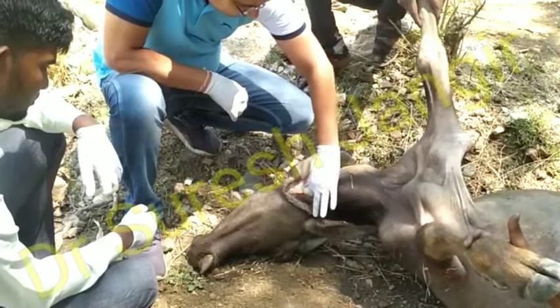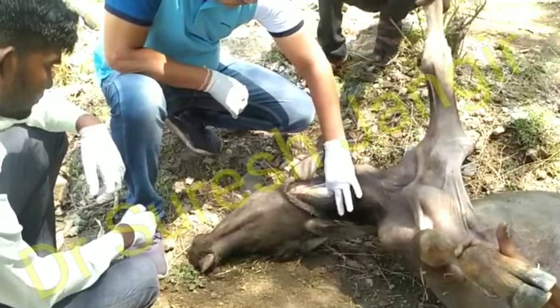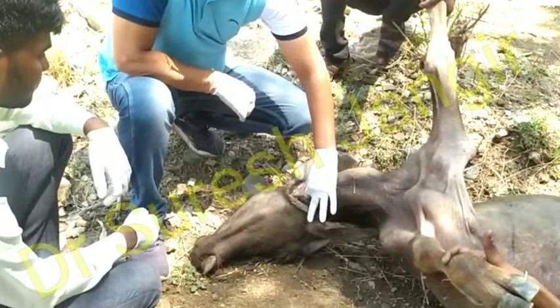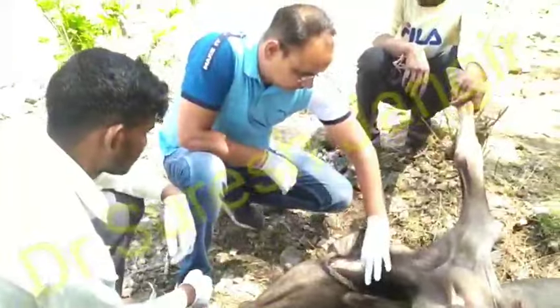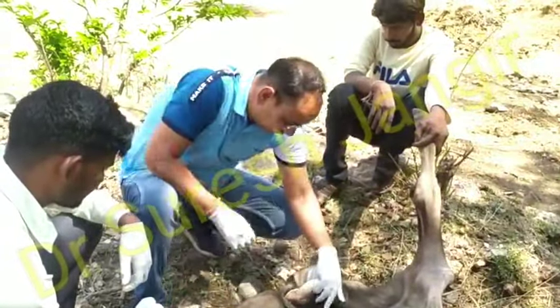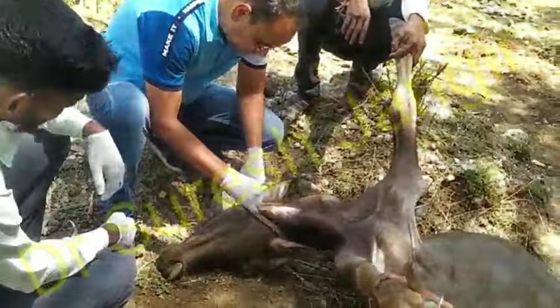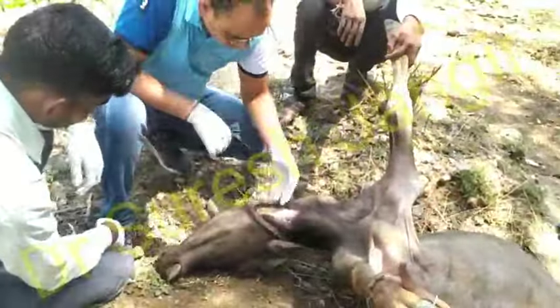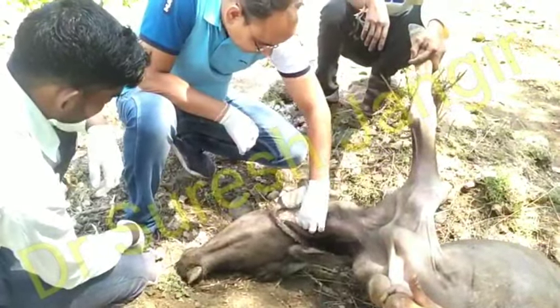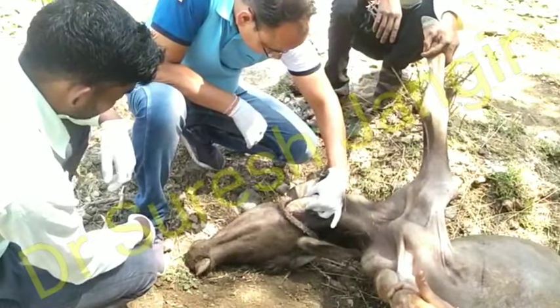We found its mouth is opened, tongue is protruded out, eyes are opened and pupils are dilated. Bite wounds are found on the neck region. On the body surface, no other wounds are found. Its tail is not found — we can say the tail is amputated.